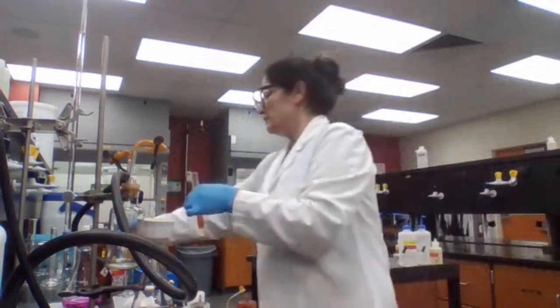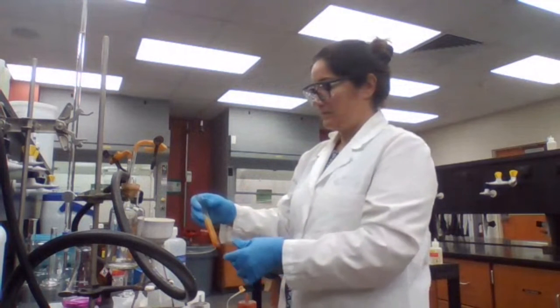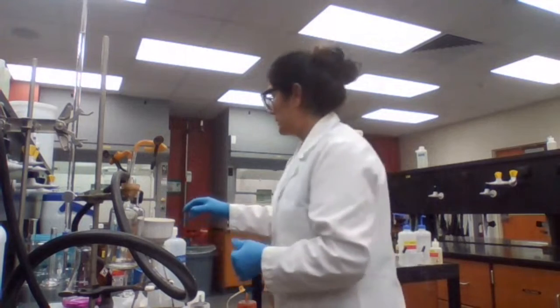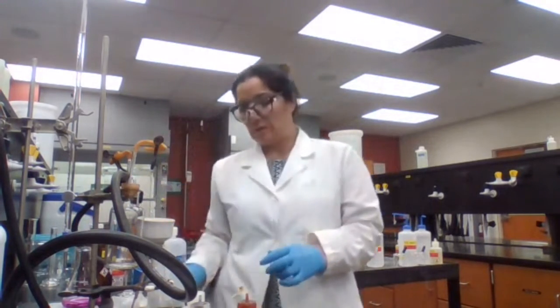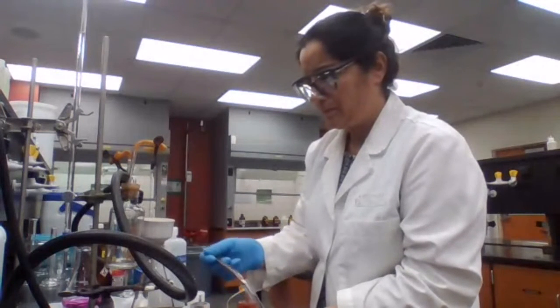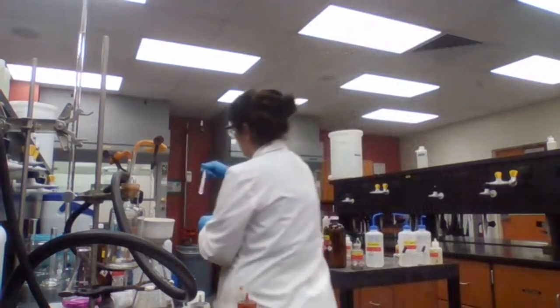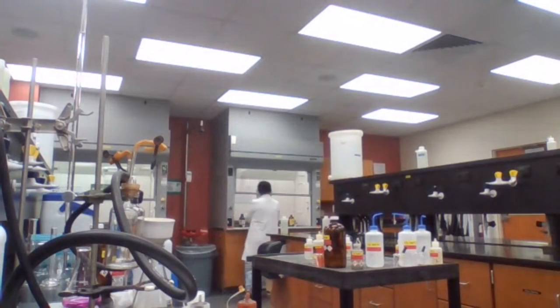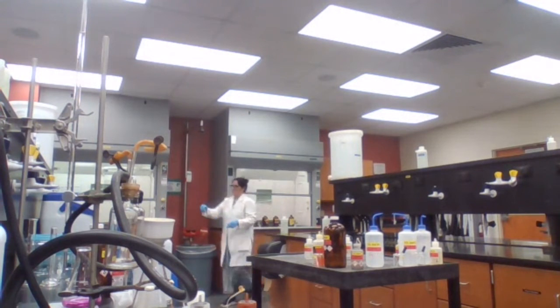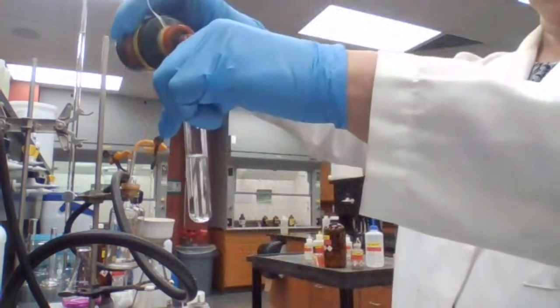Okay. Repeat this. So the sample has dissolved.